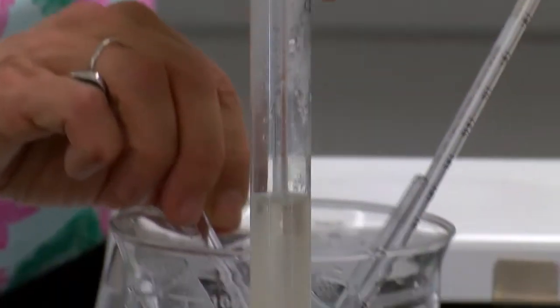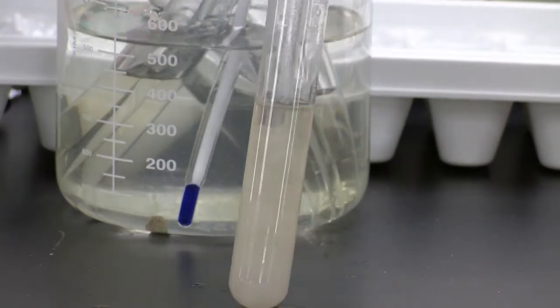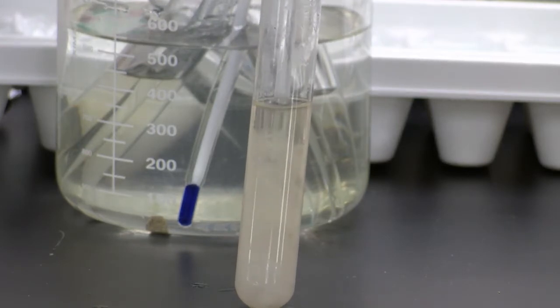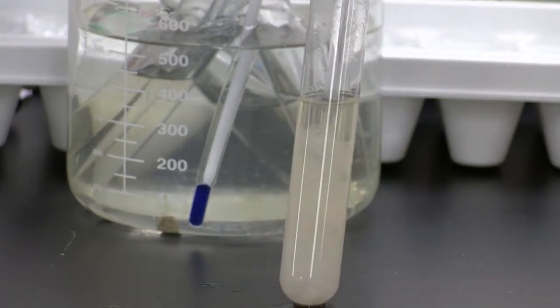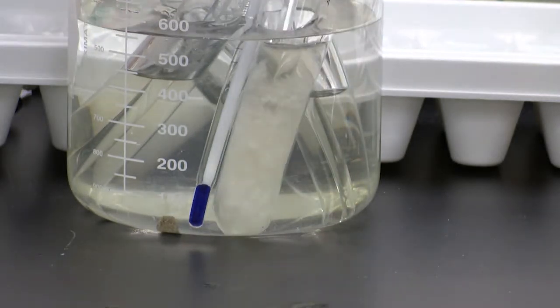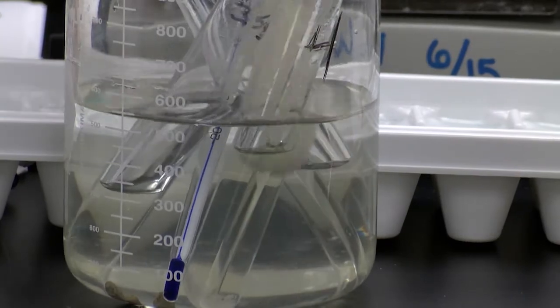Now, can you see that it's actually snowing inside the test tube? So we reached the point, and that was at 61, but I will give you this data. We reached the point where the 15 gram, the potassium nitrate, is now coming out of the solution. Okay? It's now going from liquid to solid. The next one that this would happen with is the 10 gram, and then the 5.5 and the 3.5.